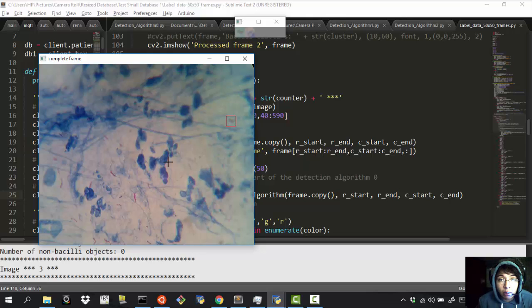For example, we have this small chunk right over here, and I just want to note, by the way, that this small chunk is a bug which I'm too lazy to fix right now, but it doesn't matter. You can do the same, because the one that is right over here changes, and it's just fine. So, as I was saying, suppose that you have this small ROI over here. If you're at the microscope, that's hard to see. But if you let the computer classify this with this software, then the sensitivity is going to increase a lot more.